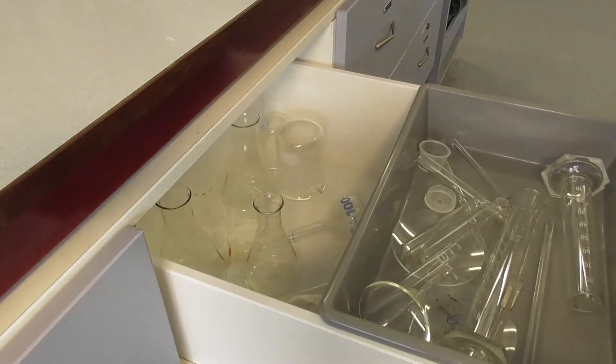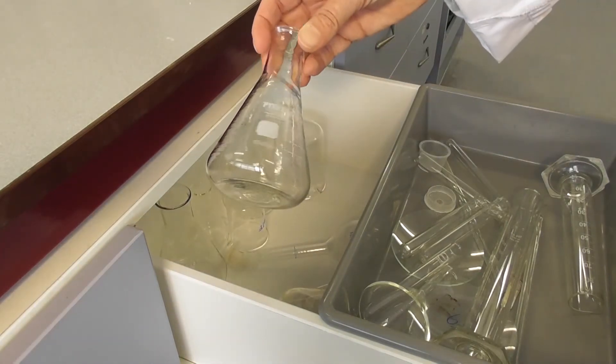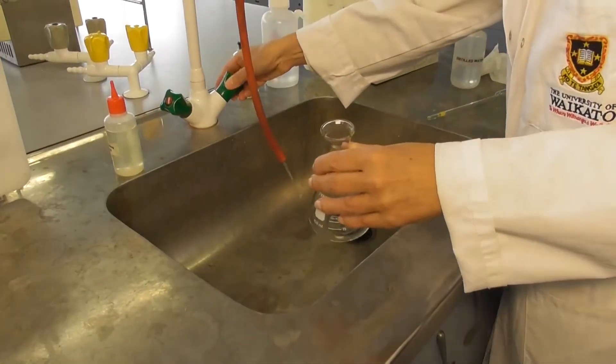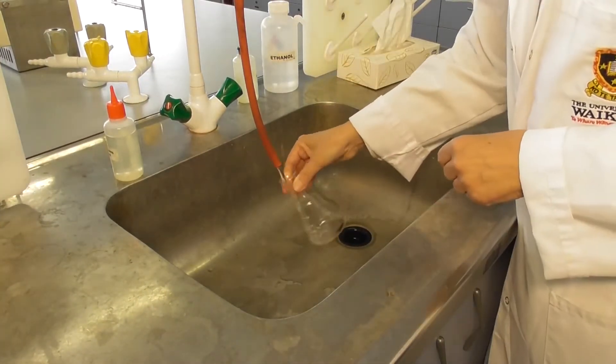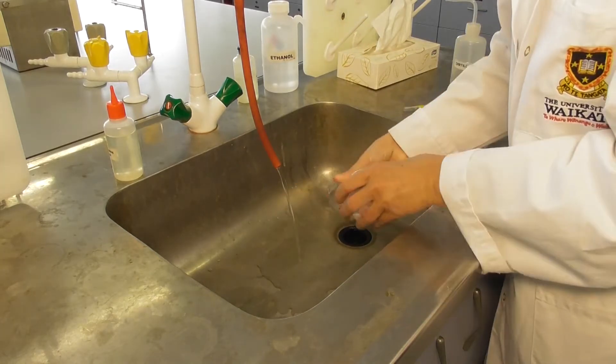When you collect glassware for your experiment, it might appear clean, but it could still contain residue from previous experiments. If you're unsure about how clean it is, it's a good idea to rinse it before using it, especially if you're doing a titration or an experiment that requires precision and care.